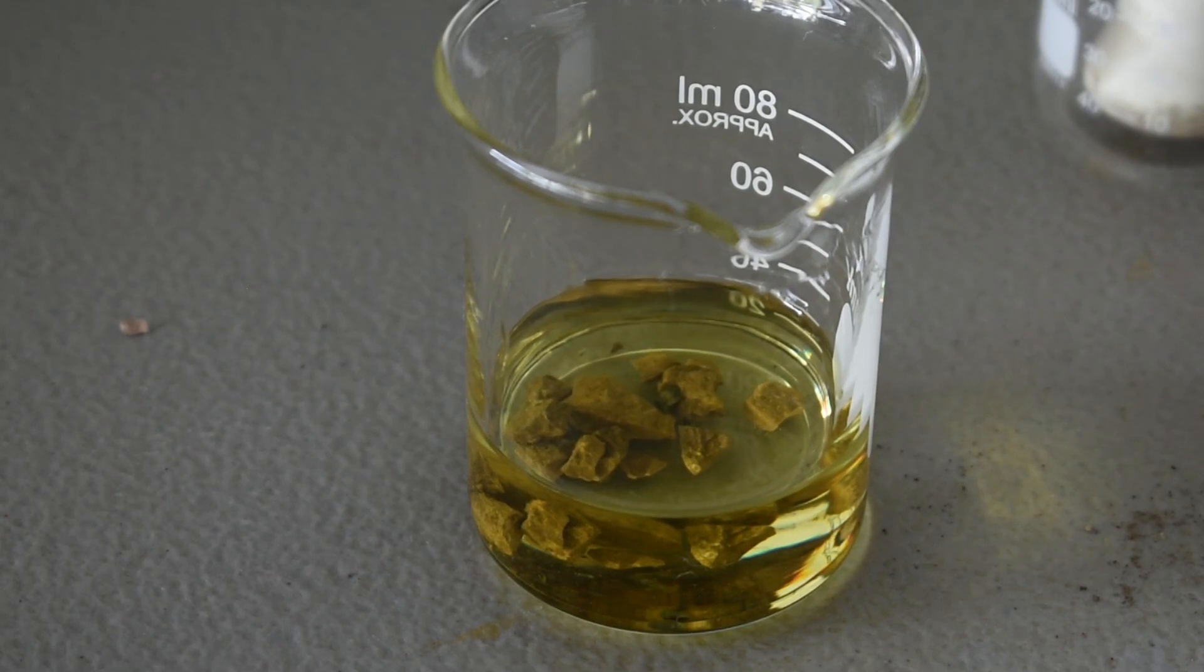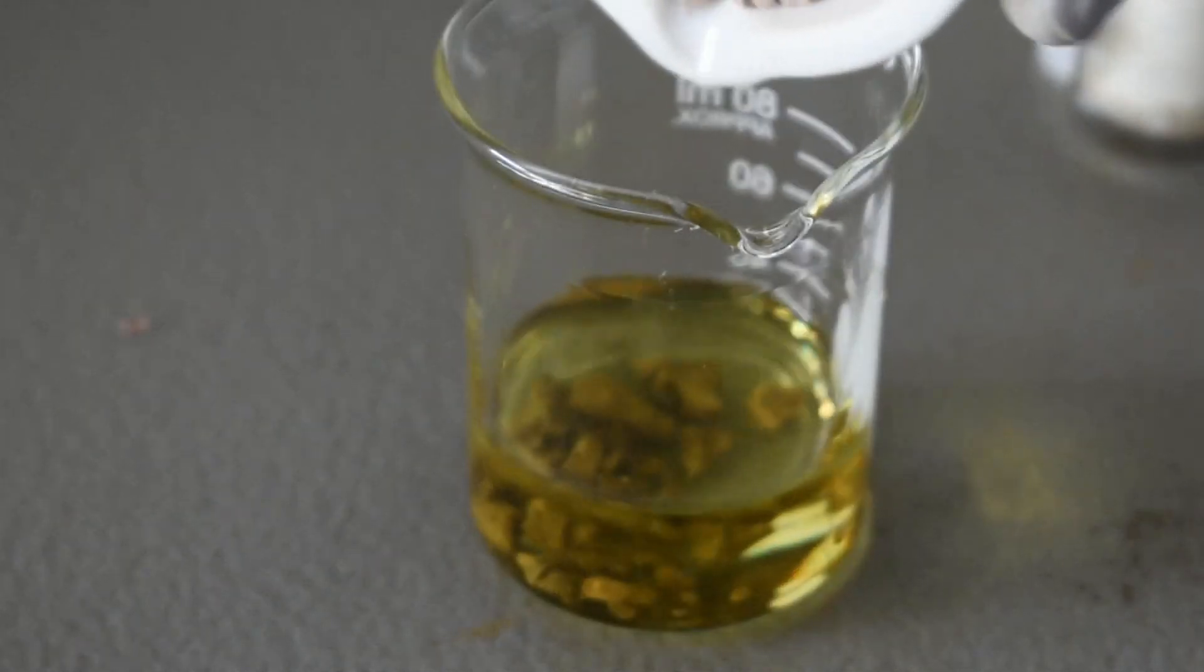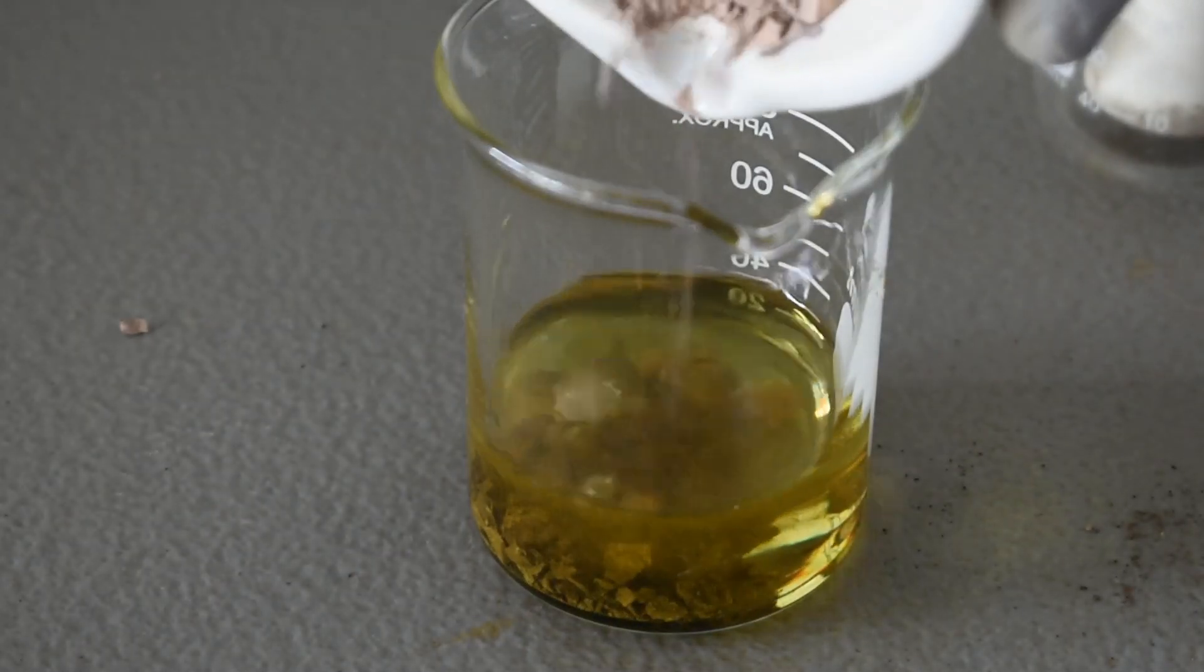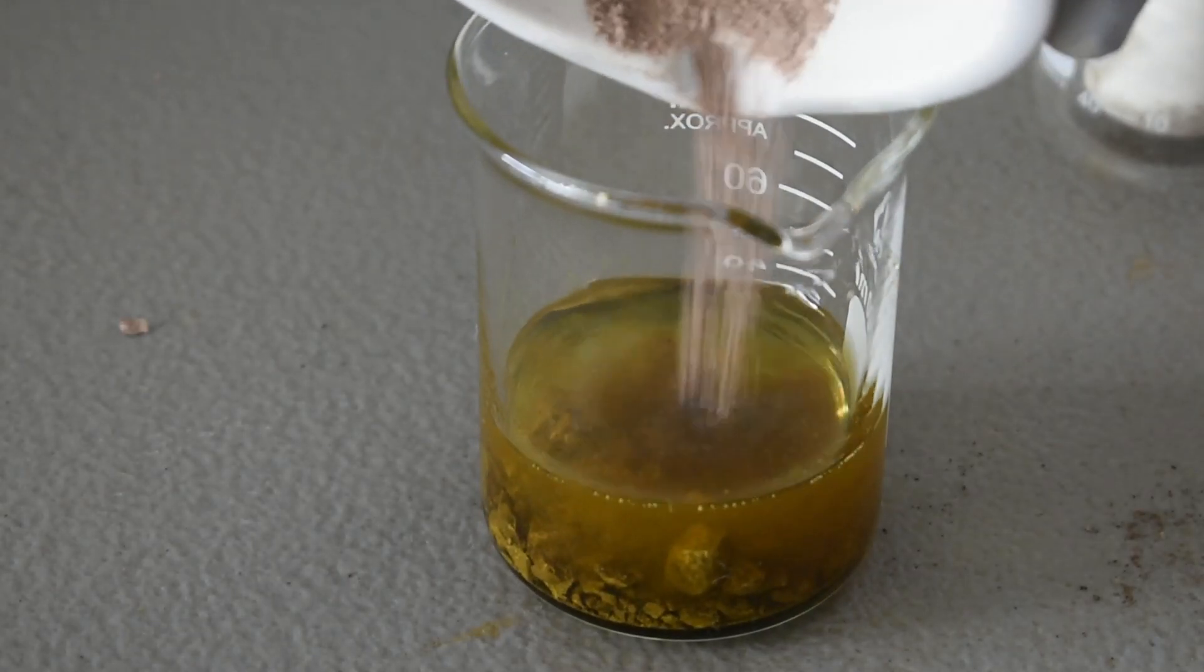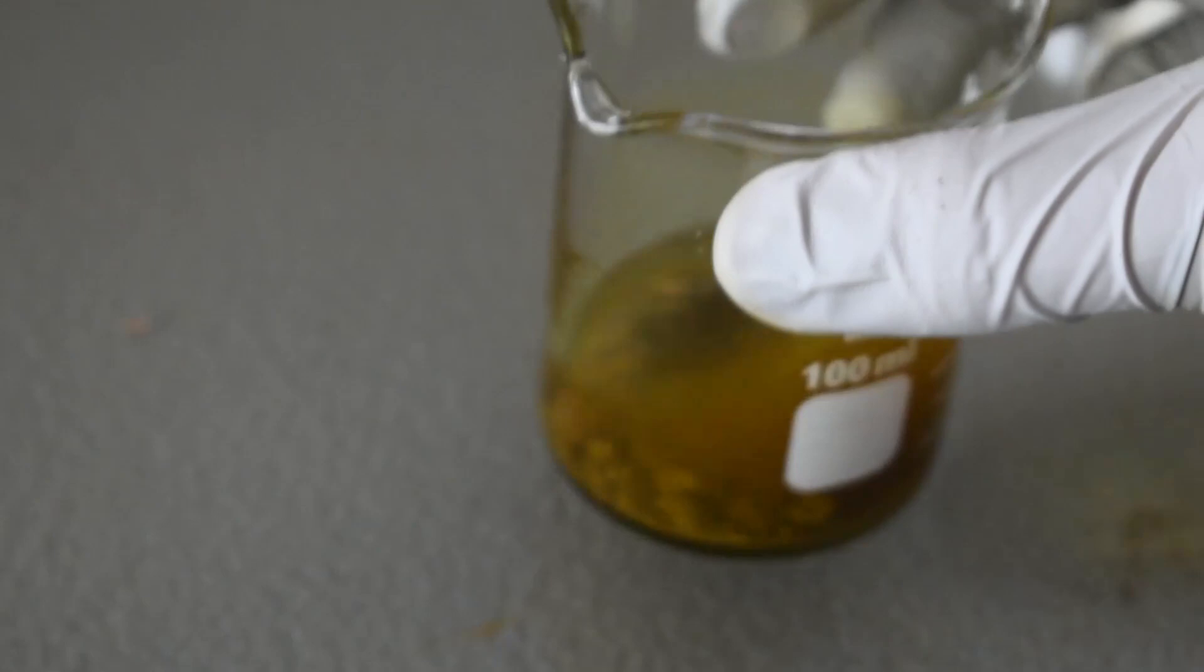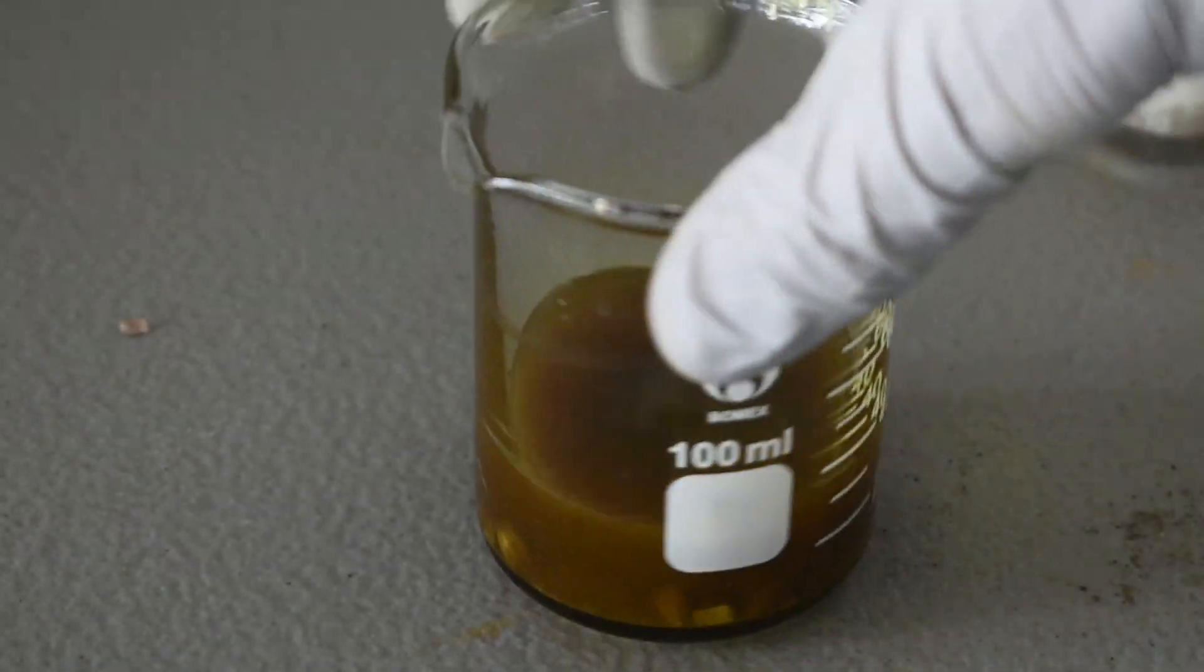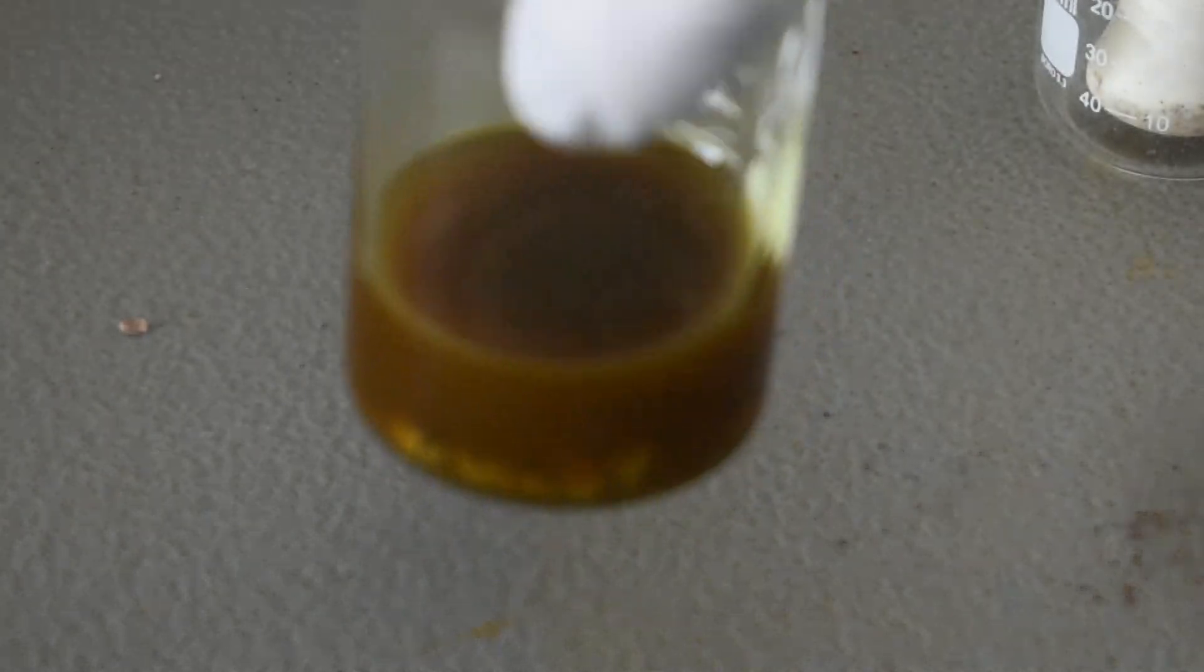And then we'll just pour in the rest. It's almost a golden color.